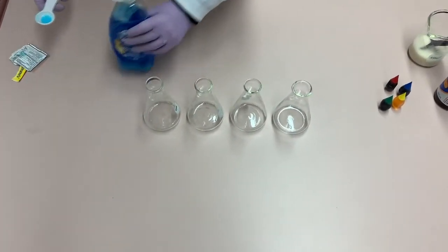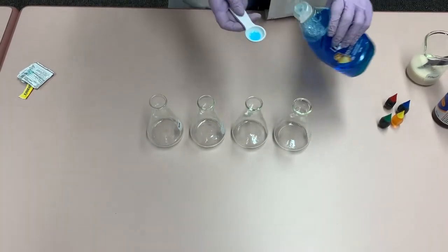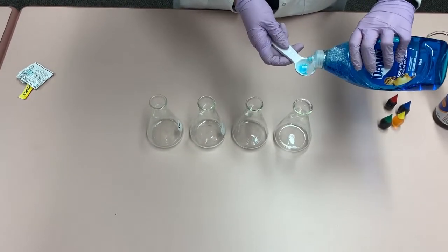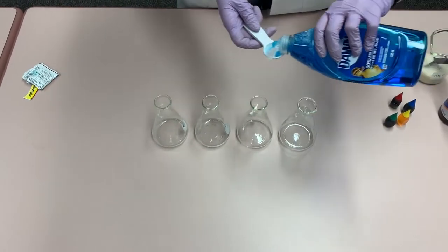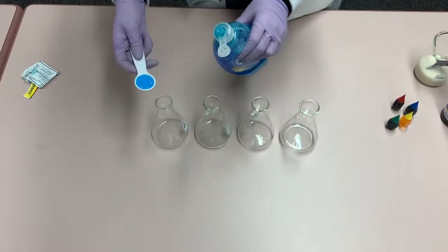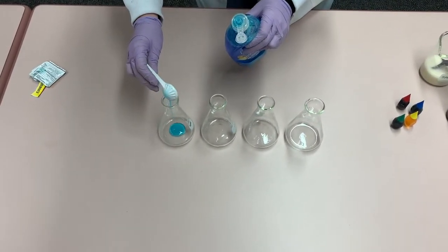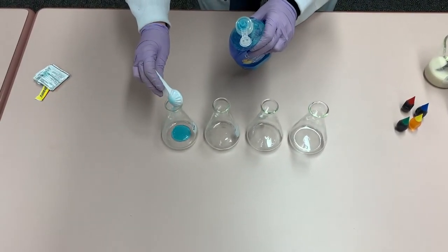Next, we take our dish soap and add one teaspoon of dish soap to each of the four flasks.